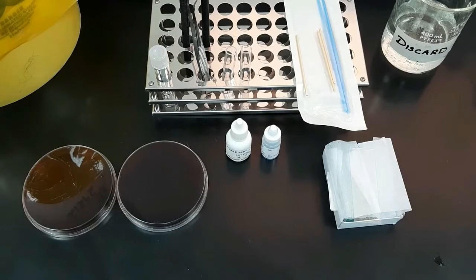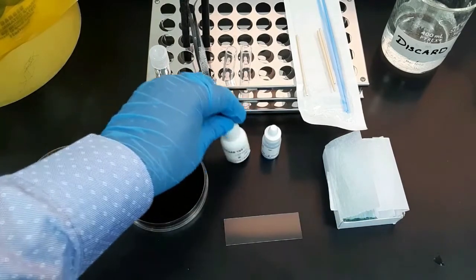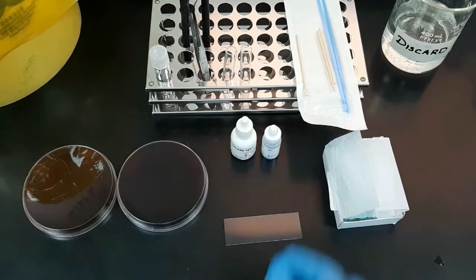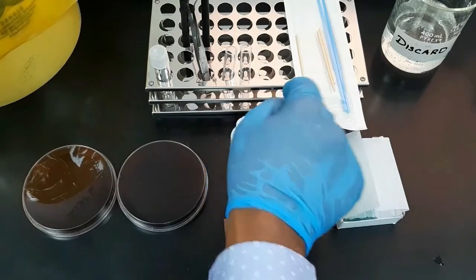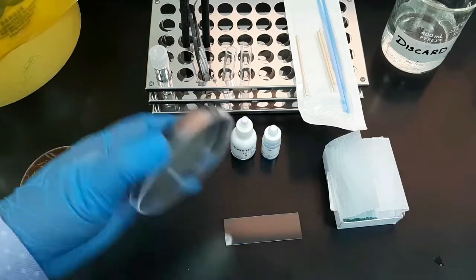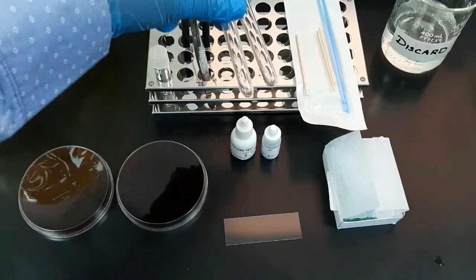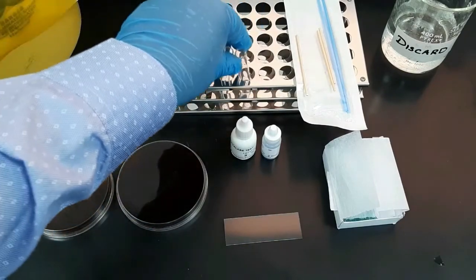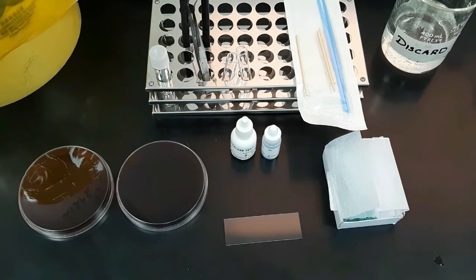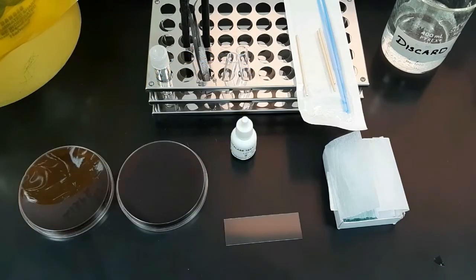To perform the catalase test using the slide method, we need a glass slide and the catalase reagent — that is hydrogen peroxide. We also need a sterile wooden stick or a disposable wire, an overnight culture of organisms, and tubes for the tube catalase method.